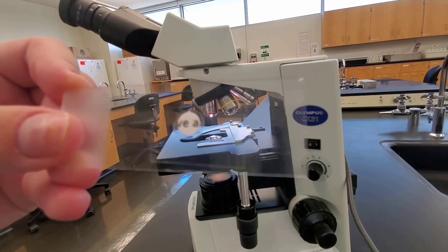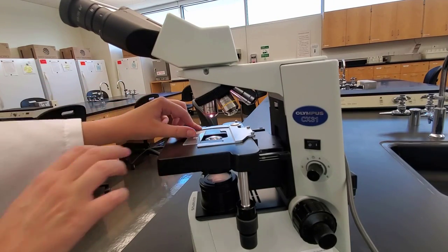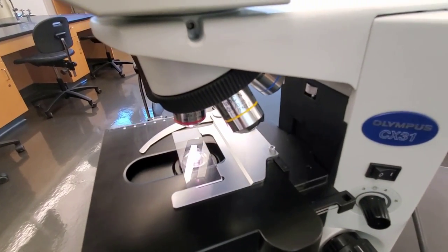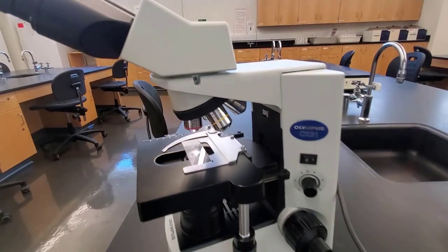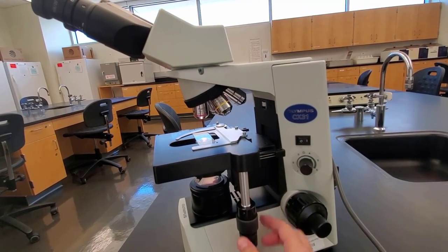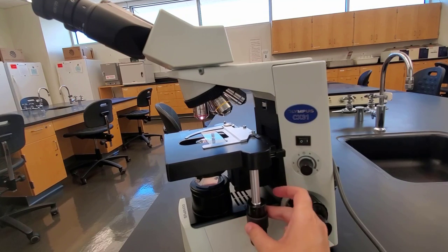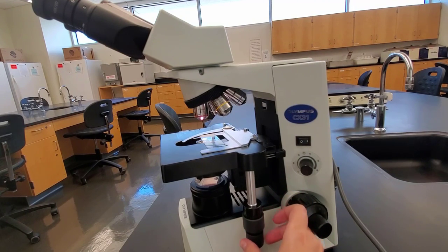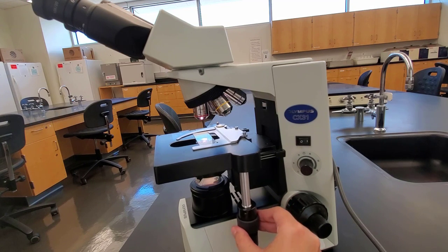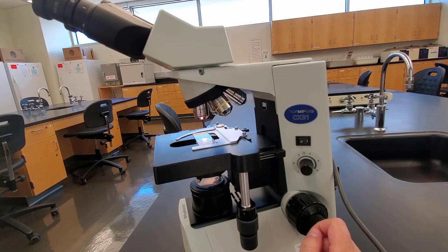We're going to use our letter E slide. Notice that the letter E is facing right side up when we put it on the stage. I put it in the stage clips so it rests nicely. Then I use the stage adjustment knobs — one moves the stage front and back, one moves it side to side — to center the E over the light.